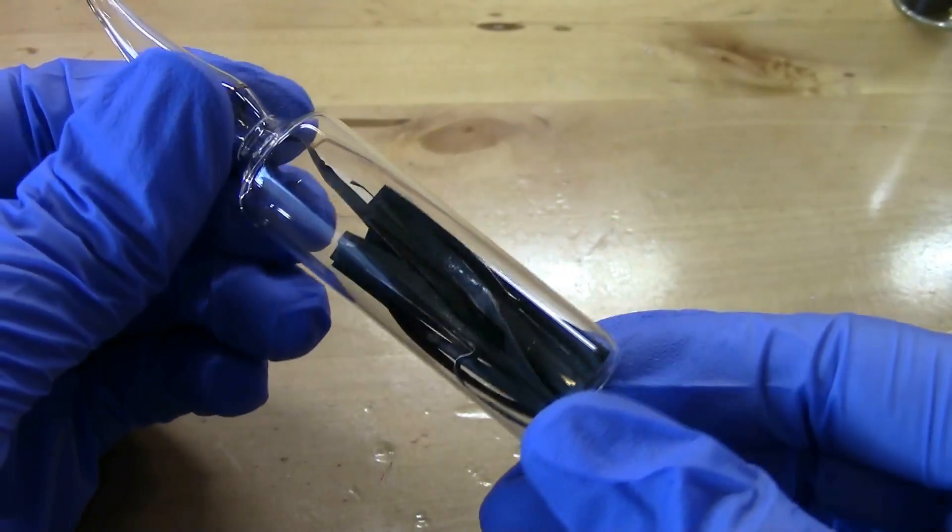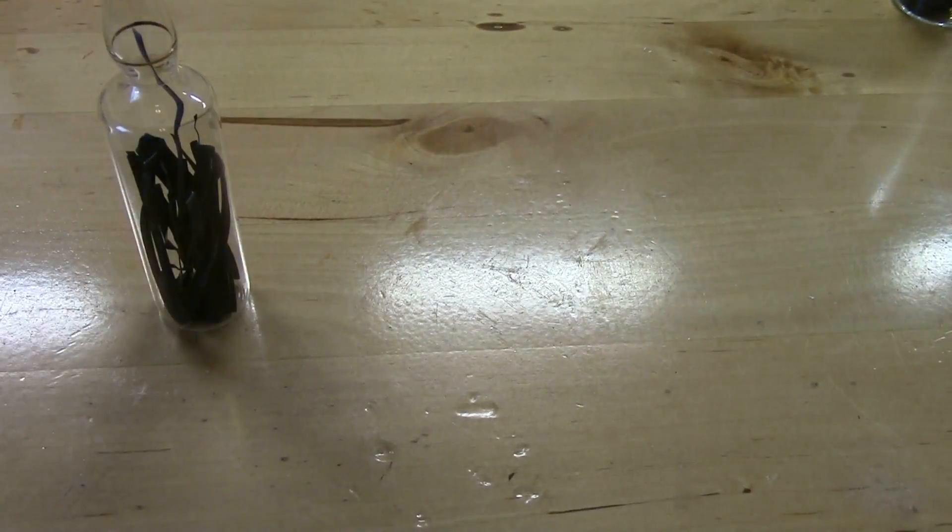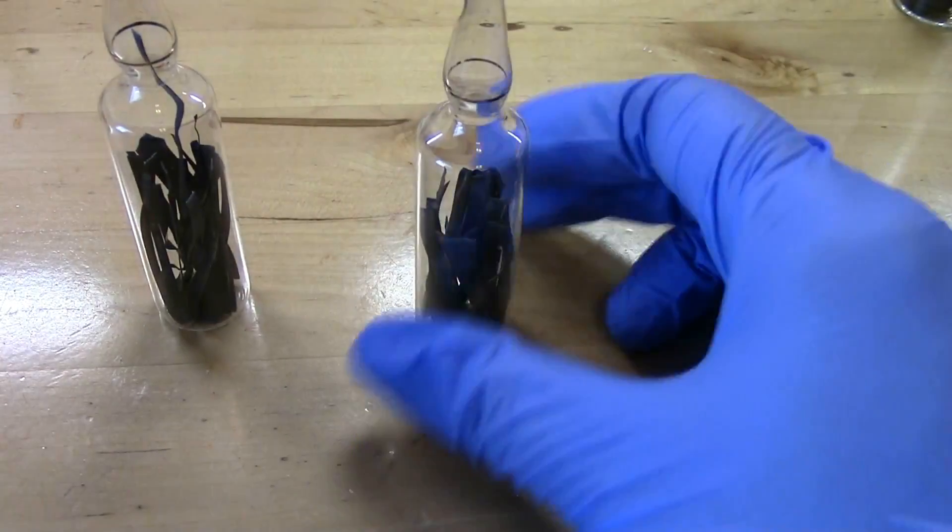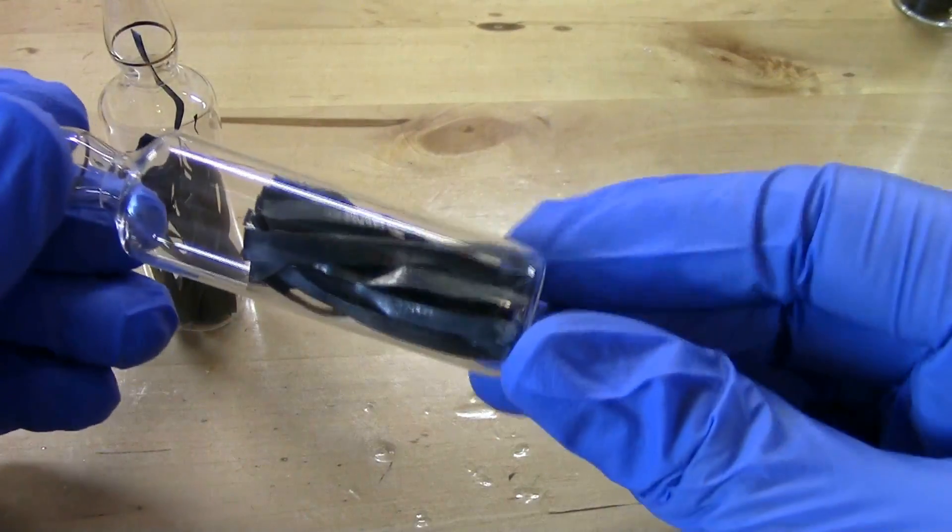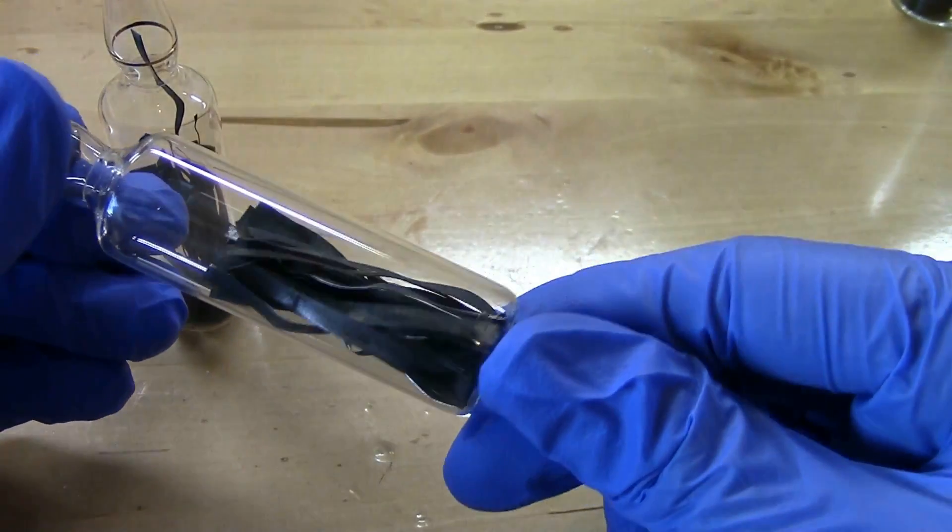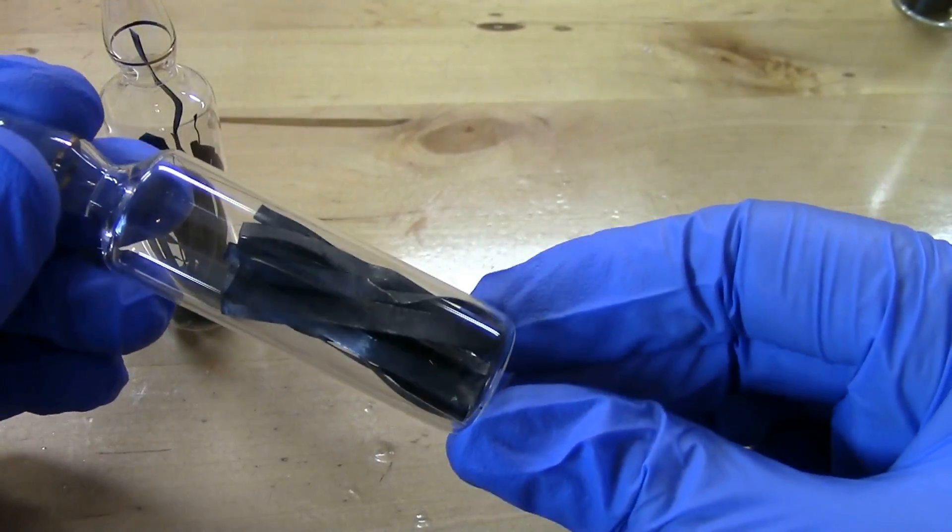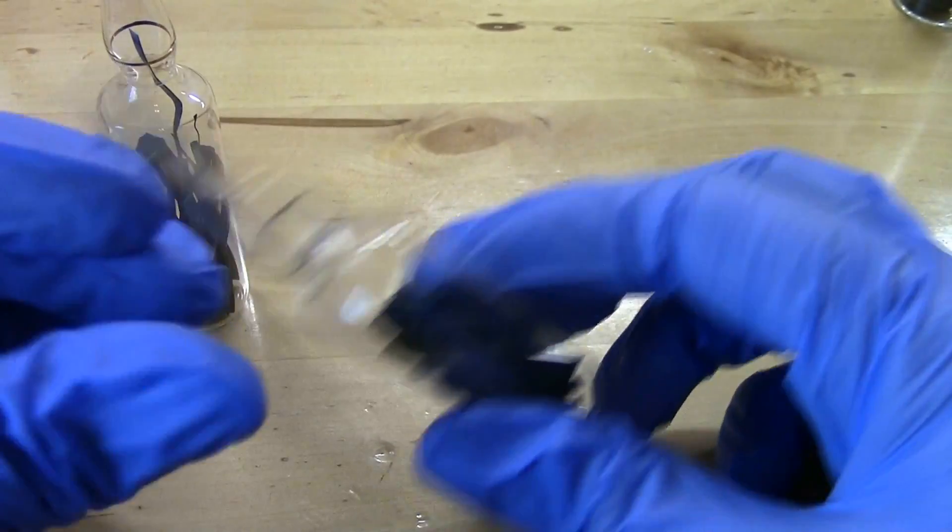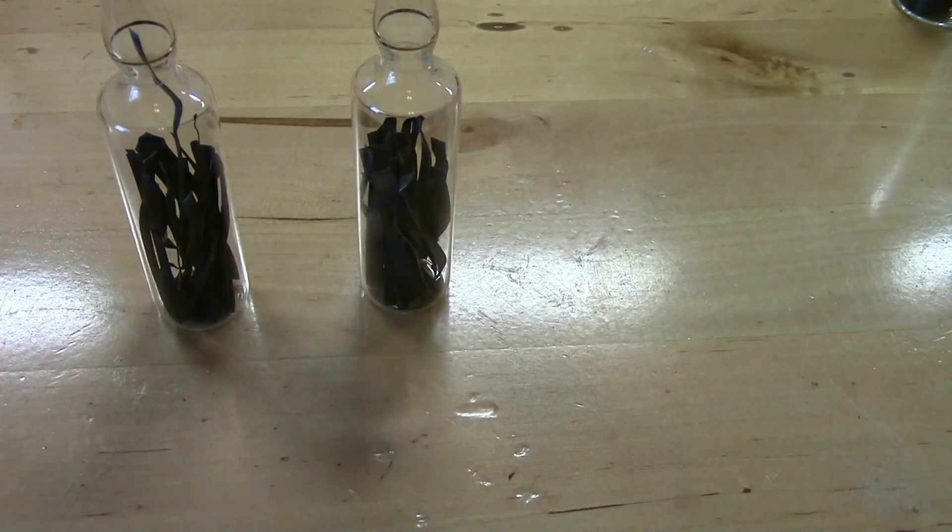So I did this with another battery as well and here's the results from that which I think is comparable but very slightly better probably because with this run I didn't actually run out of argon. So we've got those strips sealed.